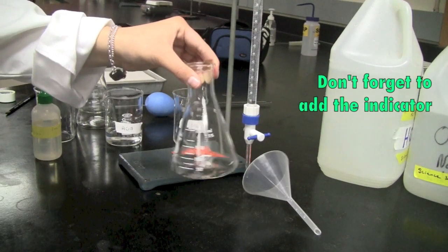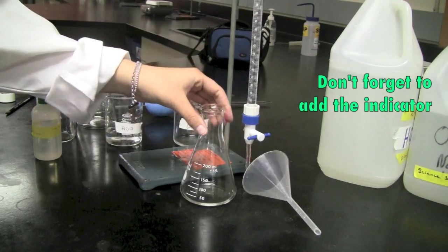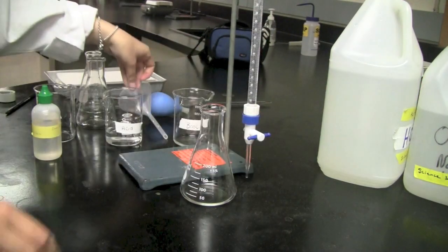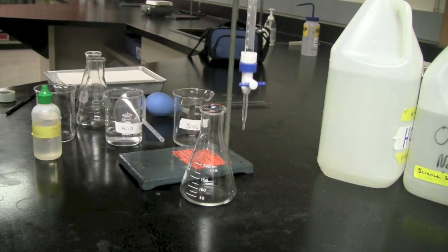And we're going to carefully place the flask right underneath the burette with the tip just below the flask.